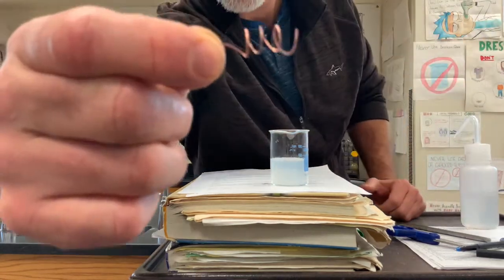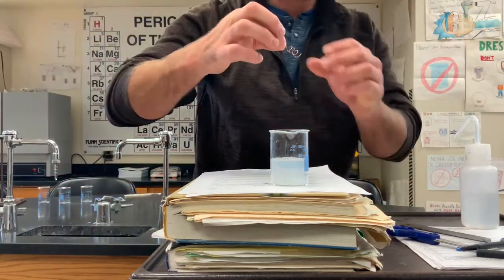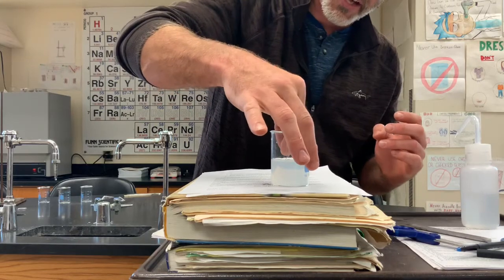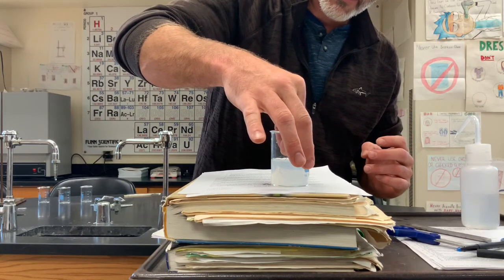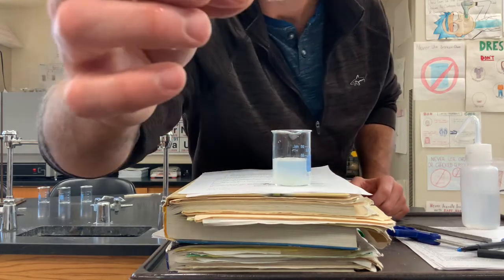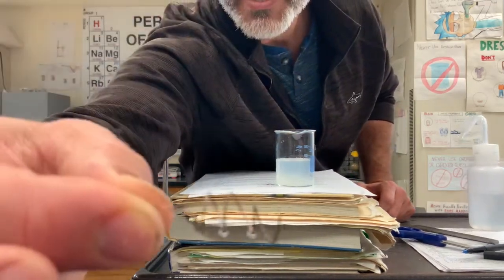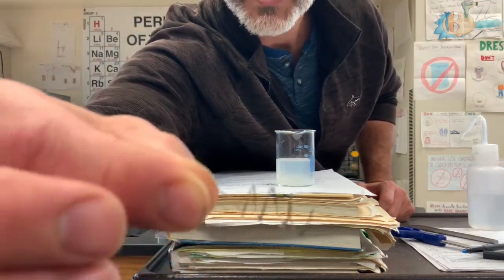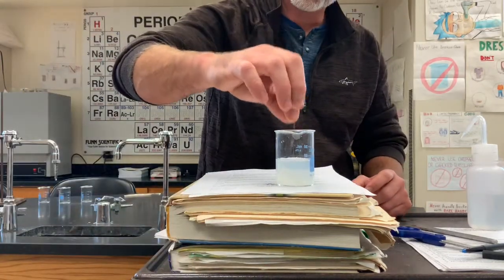I'm going to take this copper wire. It's kind of nice and shiny here. We're going to dip it in for a couple seconds. Thousand one, thousand two, thousand couple seconds. Now, if I get nice and close, I don't know if you can tell, there's some oxidation on it. Well, we're going to see what actually happens.